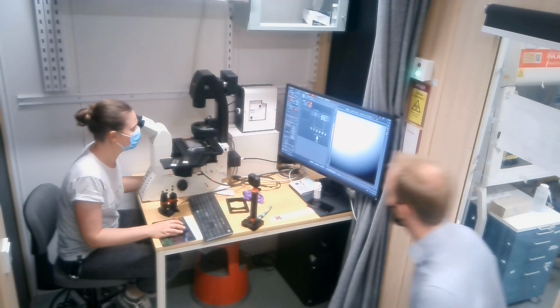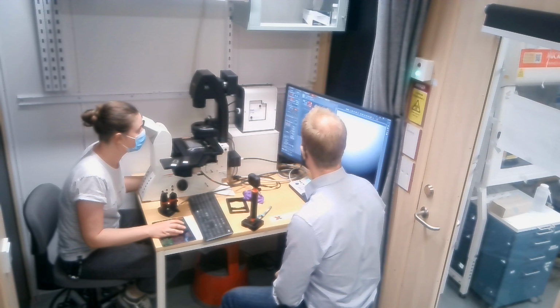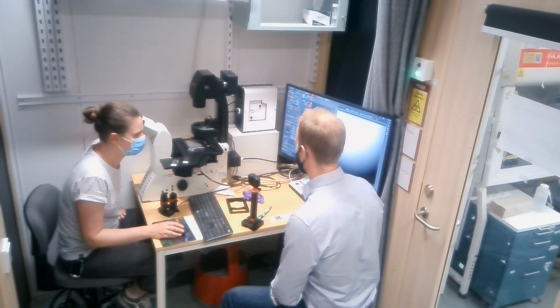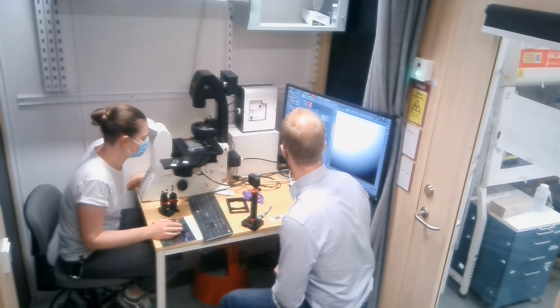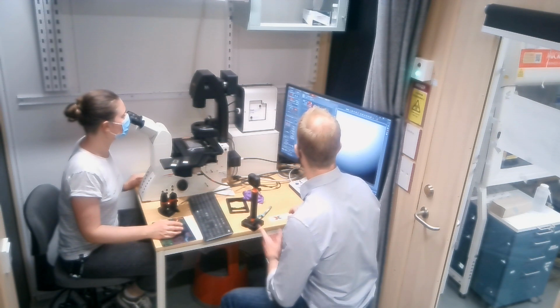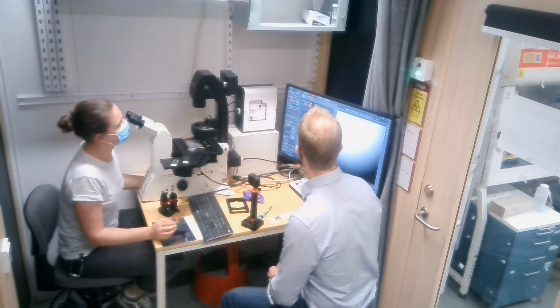Why doesn't it change to W right now? Again? Why doesn't it change to W right now? I don't know. If you click on that one there. No. Stop here. Oh, am I still here somehow? No, I think that it's not really sure. It's still live, right? So just click that one again. Okay, there's something, it's not happy. Maybe because of the scale bar? No, that should not be. Okay. Is it still live? Can you try to adjust the focus or something, or just move it a little bit? I just want to see if it's still... No, it's not moving. No. Okay, so something has frozen the software.